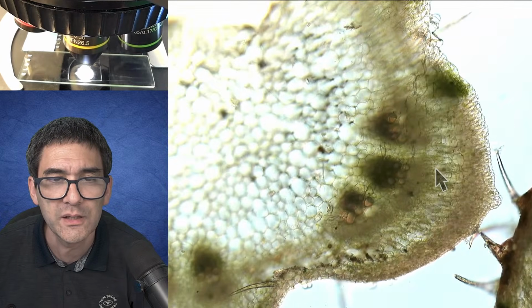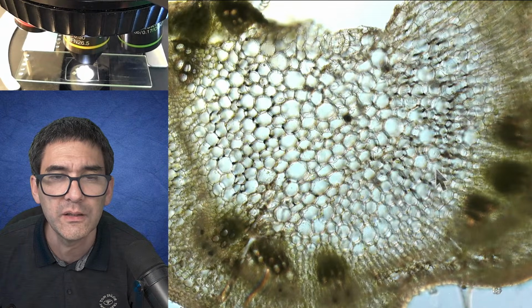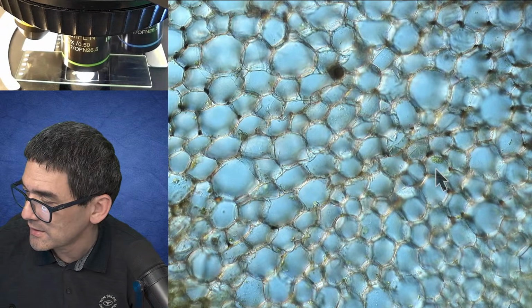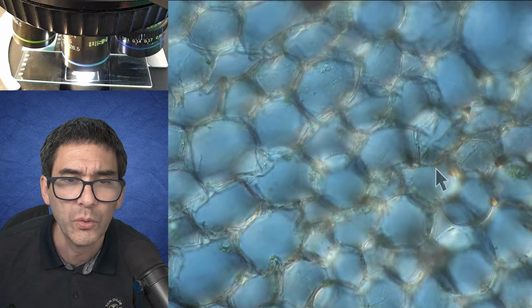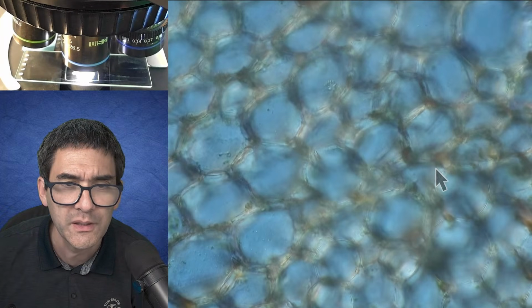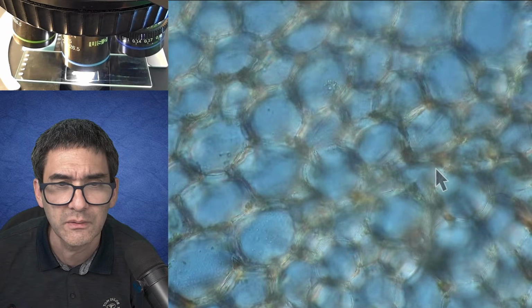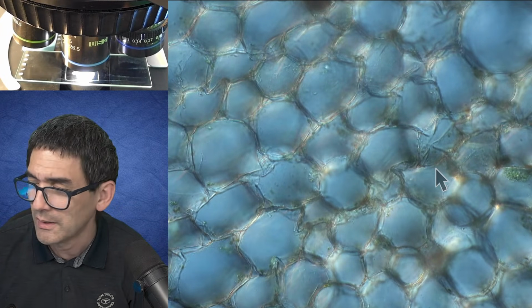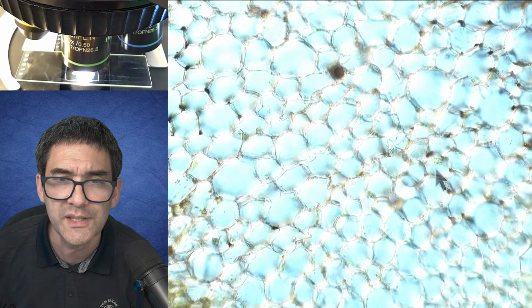And again, we're able to see, and this is the thing that kind of makes me happy, that the cross sections that you're able to make with this microtome indeed are thin enough that you are actually able to see individual cells in a way that they don't overlap. I'll show this to you again. If I focus through here, you see it's blurry, out of focus, then it goes in focus, but it's basically still the same cell walls. So this means it's probably around one, maximum maybe two cell layers thick. So I'm quite happy that the cross section is not only consistent but also fairly thin.